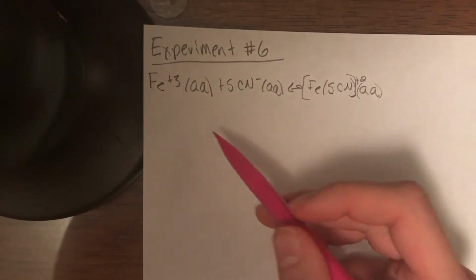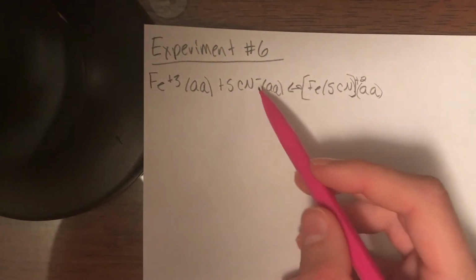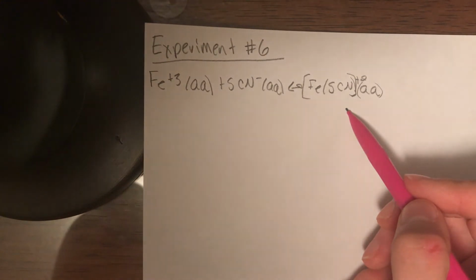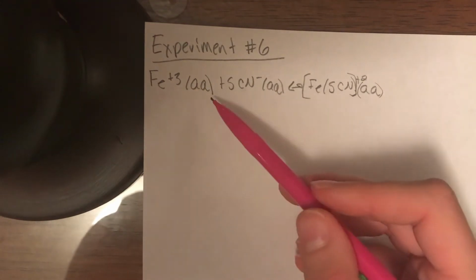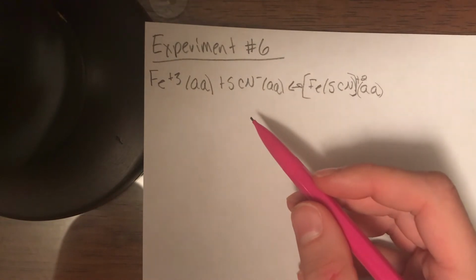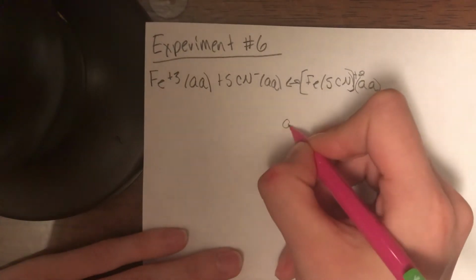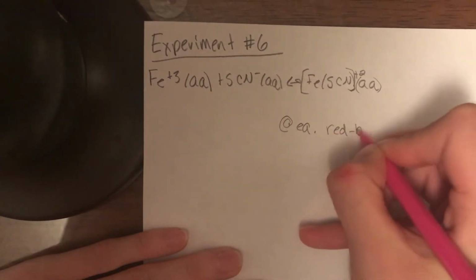It is first noted that the Fe3+ and SCN- ions are clear and colorless, and the FeSCN2+ has a light red color. Equilibrium between these was then established by mixing Fe(NO3)3 with KSCN together because they contained these ions for equilibrium. Once they were mixed, it created a deep red color. This mixture was then diluted with water, which turned the color to a dark red-brown. So at equilibrium, the color was a dark red-brown.